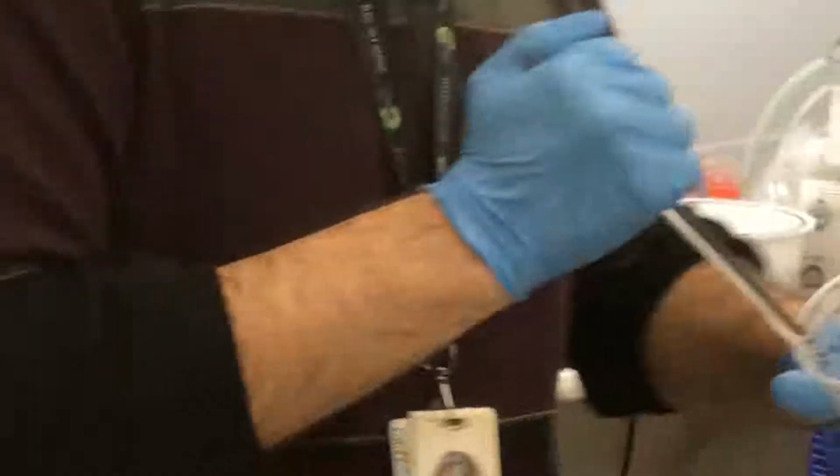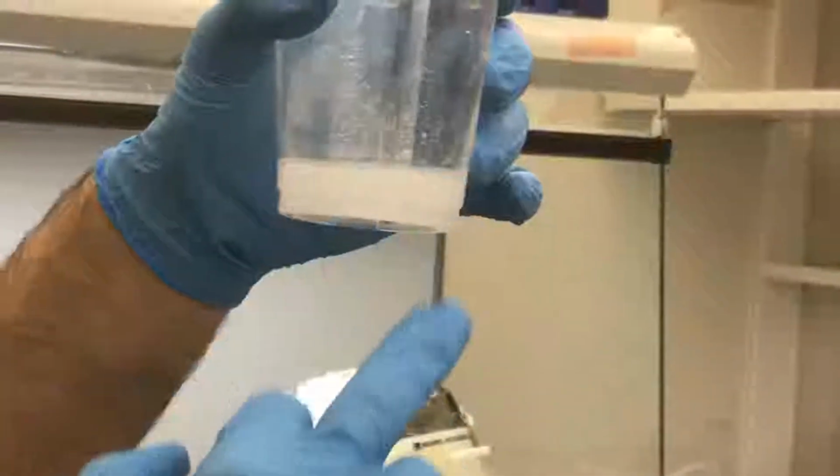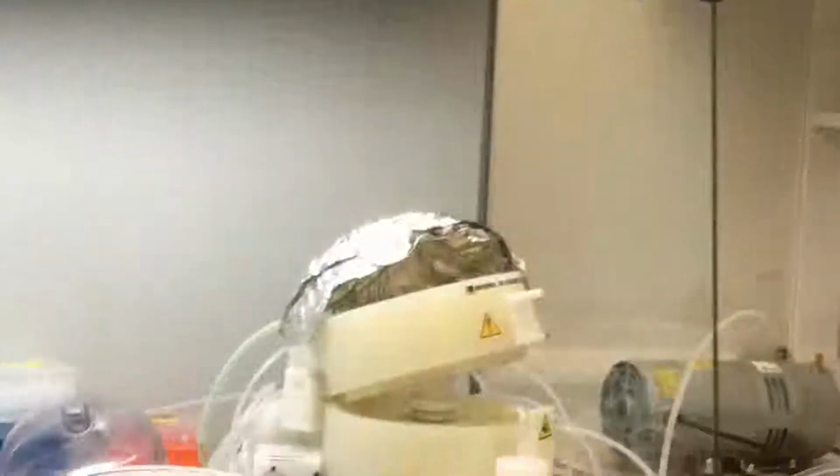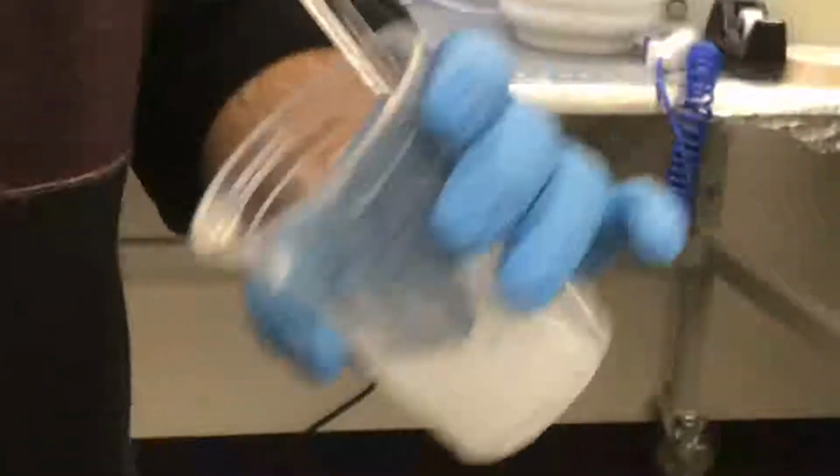The thing that you should pay attention to is the color of the PDMS. As you can see now, it is still transparent and you can still see this color. It's not white, but we should reach a white color for the mixture of PDMS and curing agent. When we reach the white, it will be opaque. Okay, Ali, you have big hands, I don't see. Just give me some seconds, then I will show you.